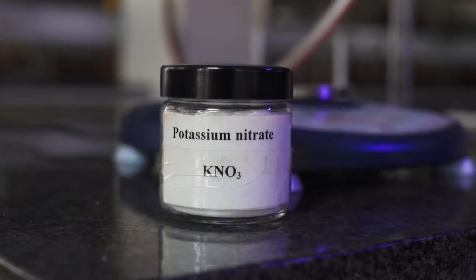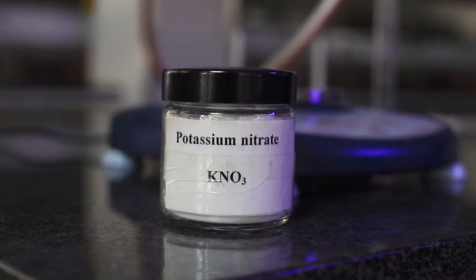For experiment one, we're going to make a potassium nitrate solution by adding a specific mass of potassium nitrate crystals into water, making sure it dissolves totally, followed by recrystallization in an ice bath. We will then filter the crystals so that we can weigh the mass that crystallized out of solution.